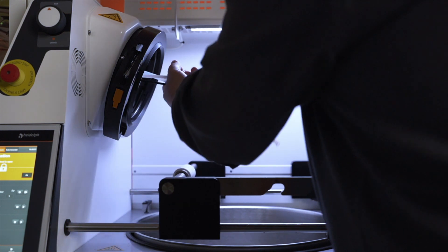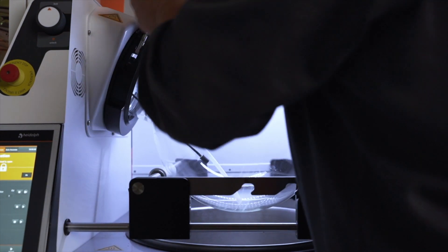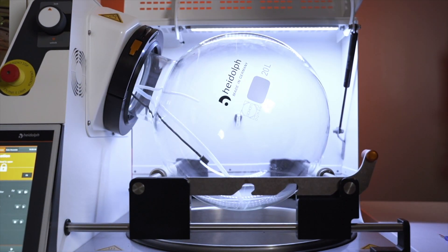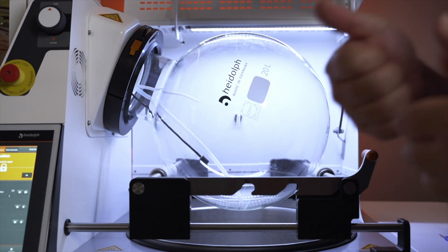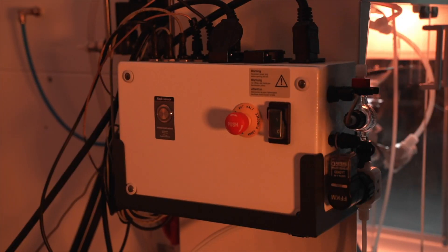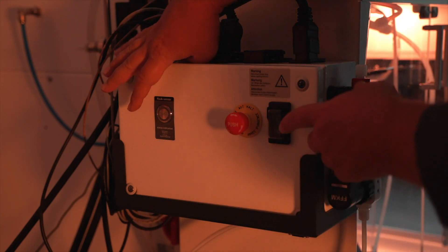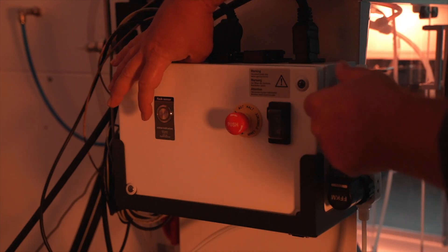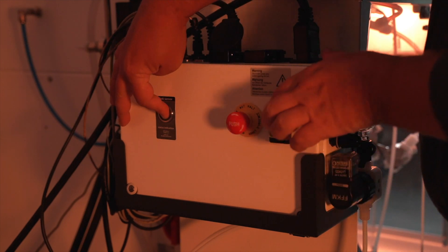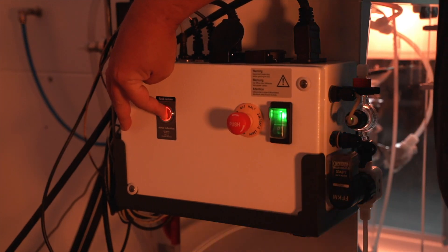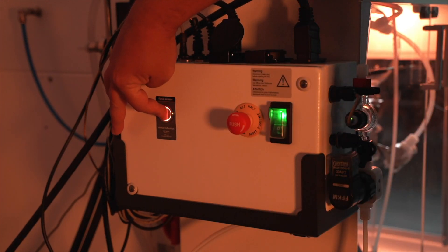Get your flask back in place and then we'll have to go around the back of the unit in order to hold down the calibration button. Okay in order to calibrate your flask sensor you're going to want the unit off. Press and hold down the silver button and turn your unit on and as you can see that button starts flashing between red and green and we want to see that go solid green and then that sensor is properly calibrated.